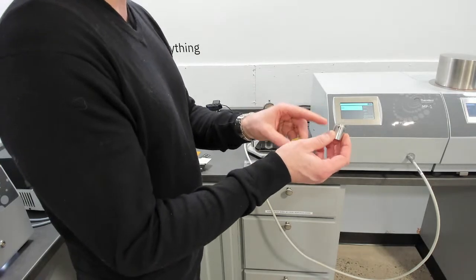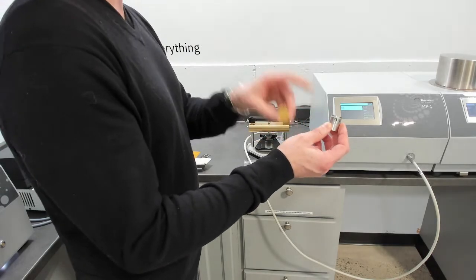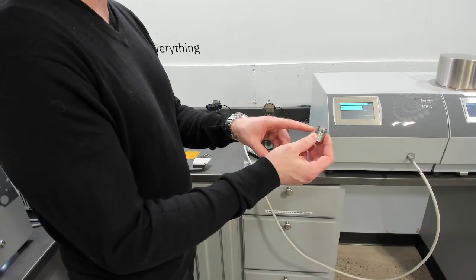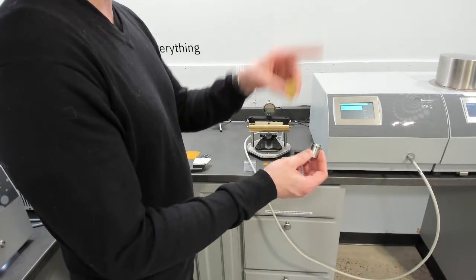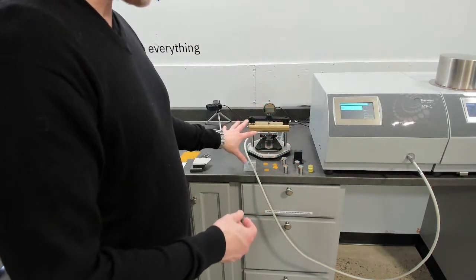If the added tape or adhesion you're adding has poor contact between the two layers, you can approach that sample much the same way as freestanding thin films where we simply do one, two, and three layers and map out the change in resistance with thickness.